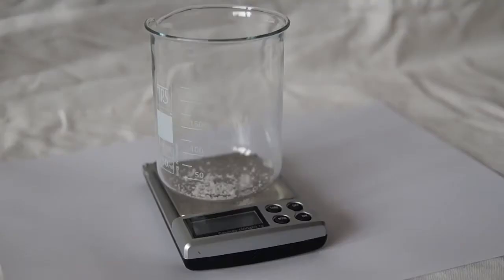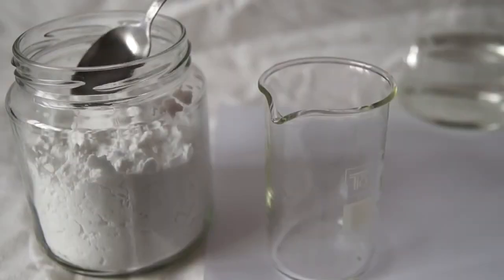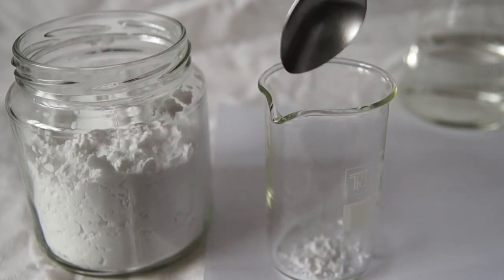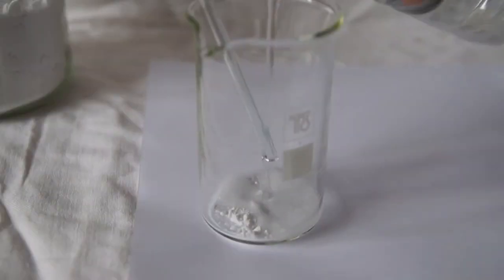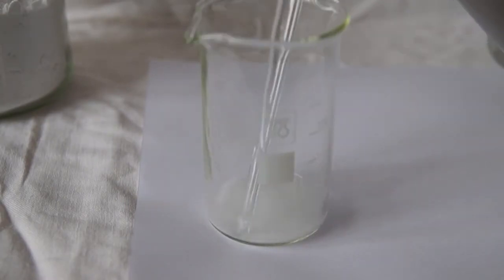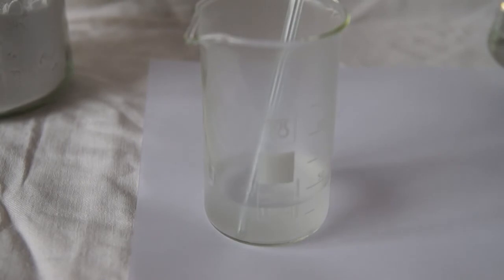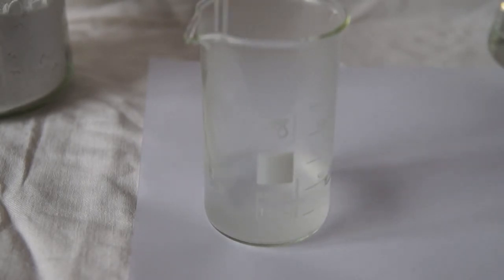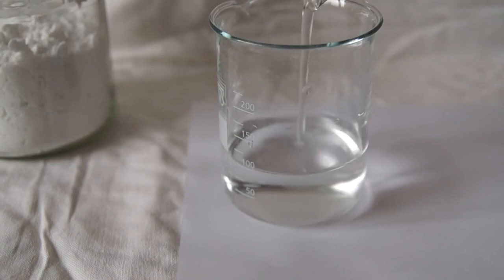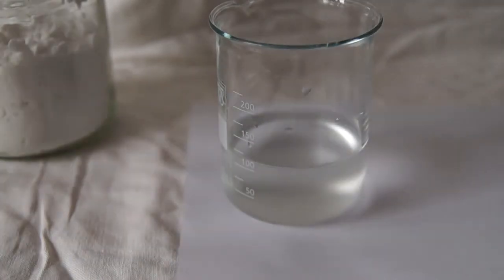Take a second beaker and dissolve there a little soluble potato starch. Dissolve starch in cold water, then pour boiling water into the beaker to better dissolve the starch. The solution becomes slightly cloudy. Next, pour the starch solution into the first solution where we have a mixture.